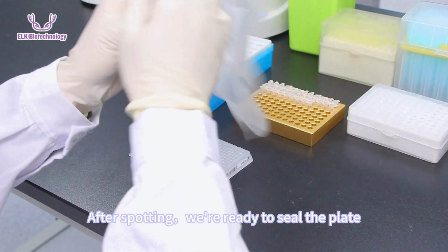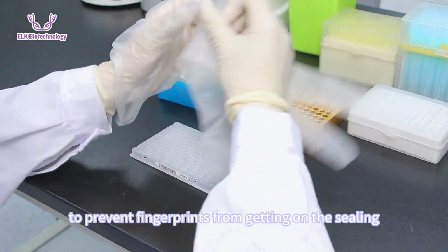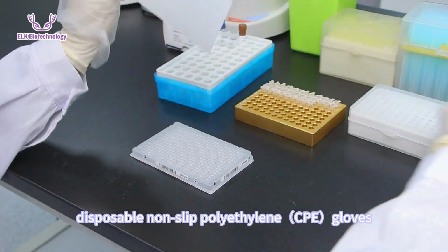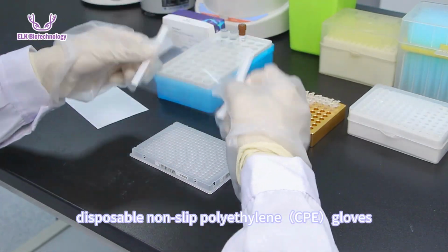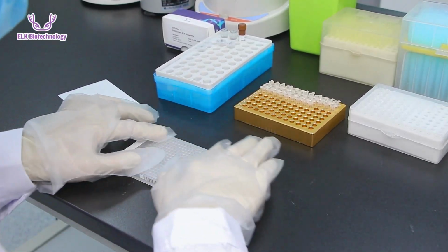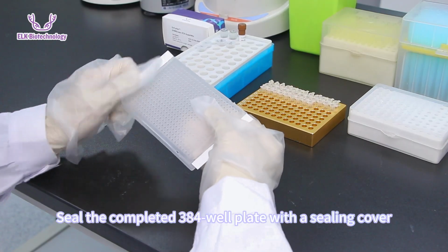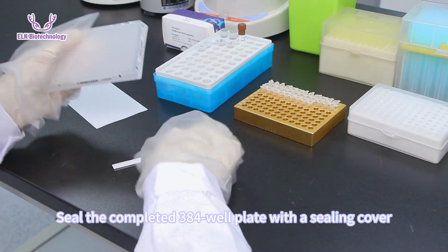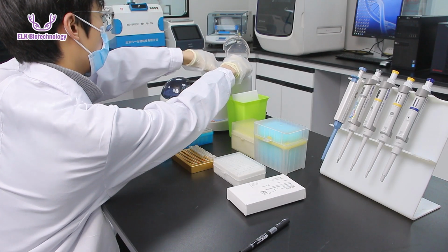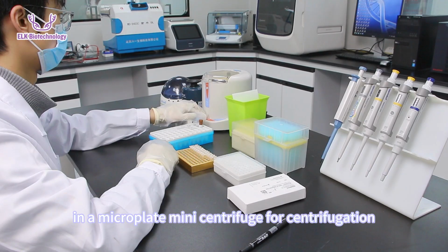After spotting, we're ready to seal the plate. It's important to note that to prevent fingerprints from getting on the sealing membrane and affecting experimental results, disposable non-slip polyethylene CPE gloves should be worn during subsequent operations. Seal the completed 384 well plate with a sealing cover. Press the edges tightly and place the sealed 384 well plate in a microplate mini centrifuge for centrifugation.